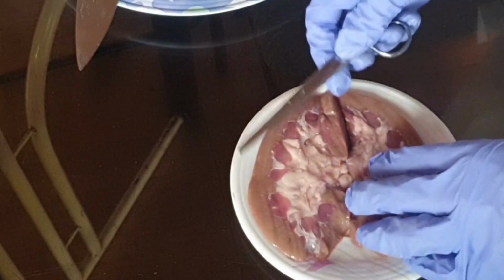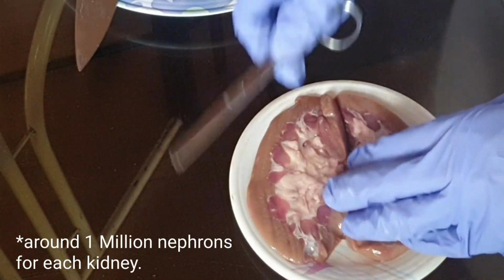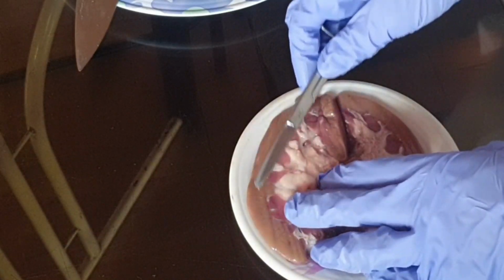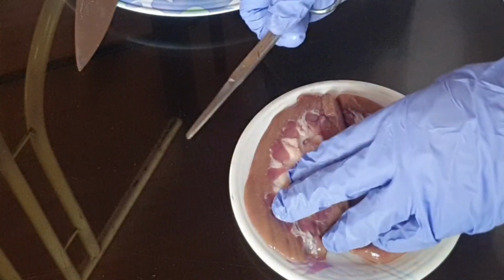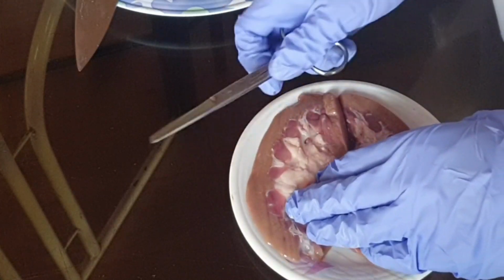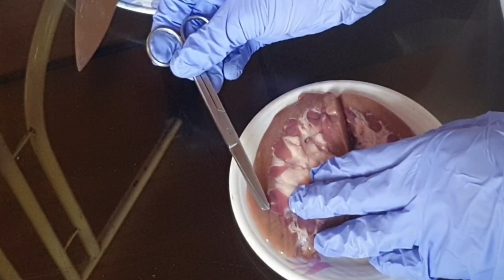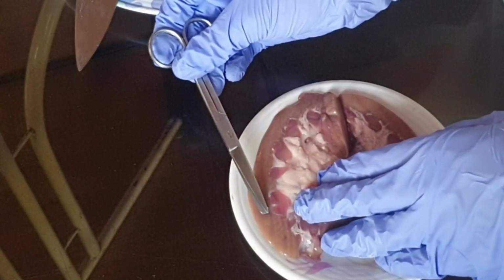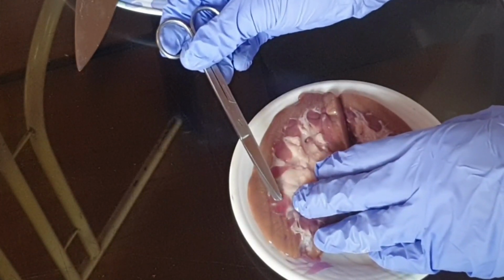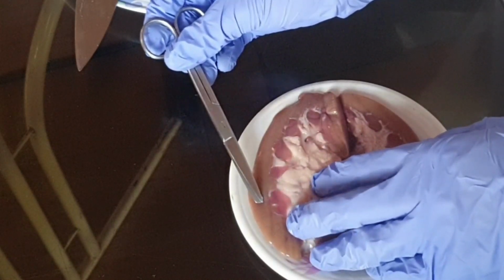Okay, so the site of filtration, the glomerulus, is part of the nephron, where each kidney contains millions of nephrons. The filtrate goes to the PCT, or the proximal convoluted tubule. It is located here in the cortex, where most of the absorption and reabsorption occurs. Then it goes down into the loop of Henle. The loop of Henle dips down here from the cortex into the medulla. Then it goes up again, from the descending to the ascending limb.